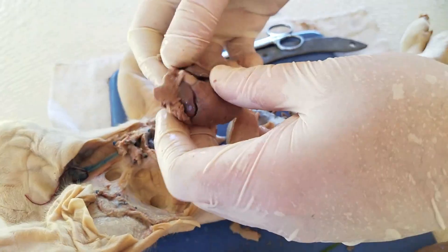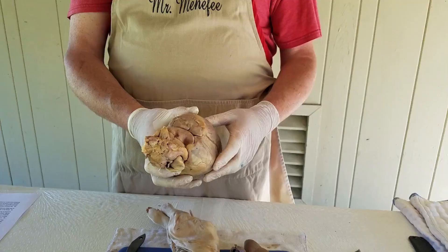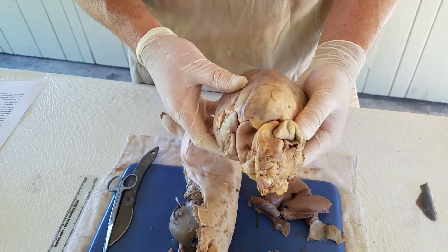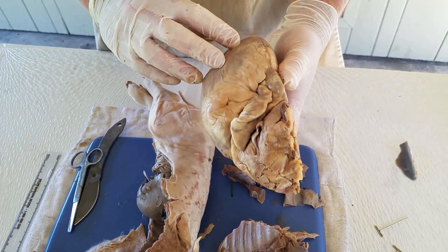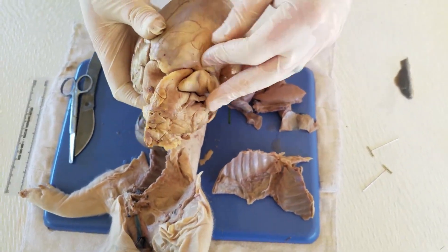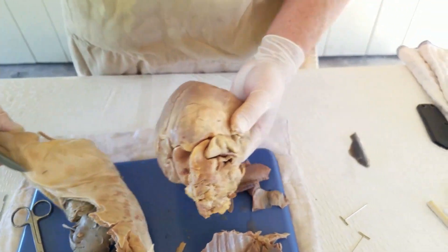Second step: the heart. We're taking a look at the heart and its various ventricles. Now I'm going to switch to a much larger heart so it's a little bit easier to see. This is a regular-size pig heart and this is a fetal pig heart — this is closer to what you would find inside of a human. So what would we be looking for? First we look on the outside: is there any damage? Any bullet holes or knife wounds? Any ruptured anything? We'd also take note — this heart's in pretty decent shape. It's got some fatty tissues on it; the white is an indication of fatty tissue. And then we would cut it open.